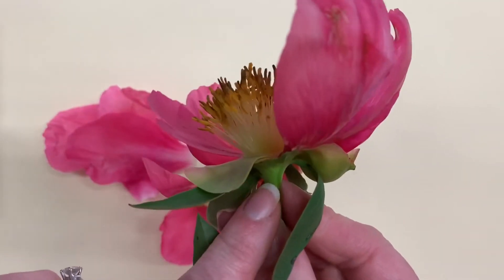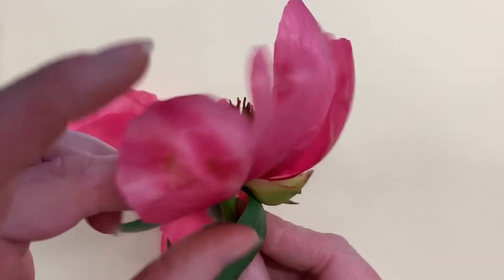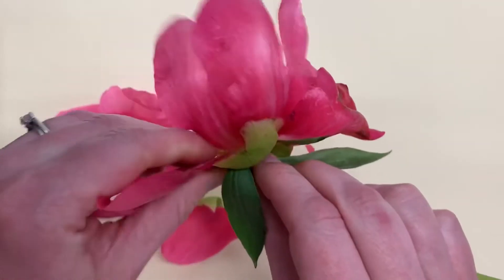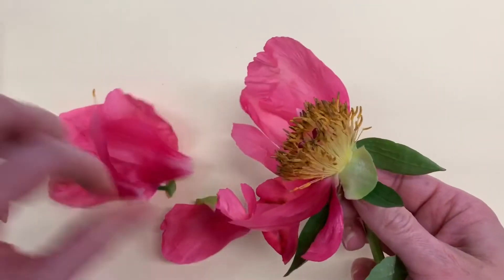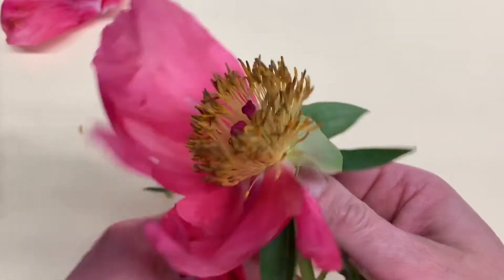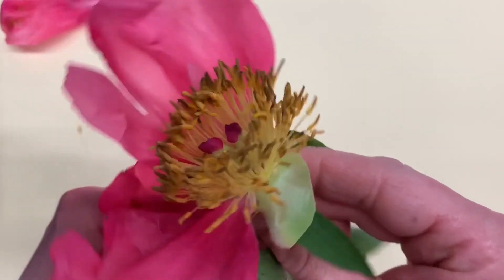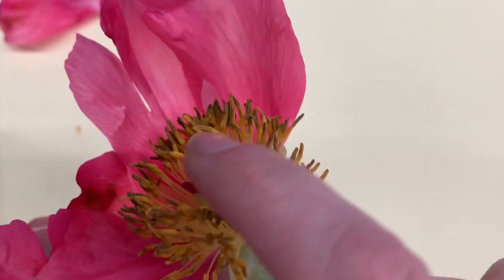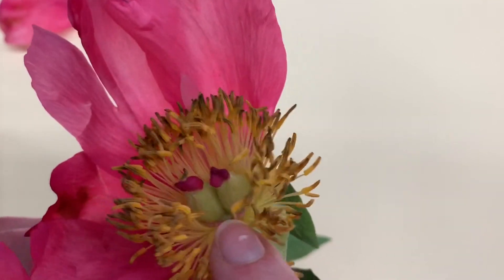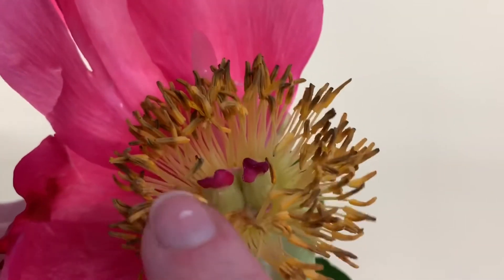This is the receptacle down here, which is where the flower attaches to the stem. I'll take the petals and put them off to the side. Remember we had talked about how the male reproductive structures surround the female reproductive structures, which you can see in the middle here.